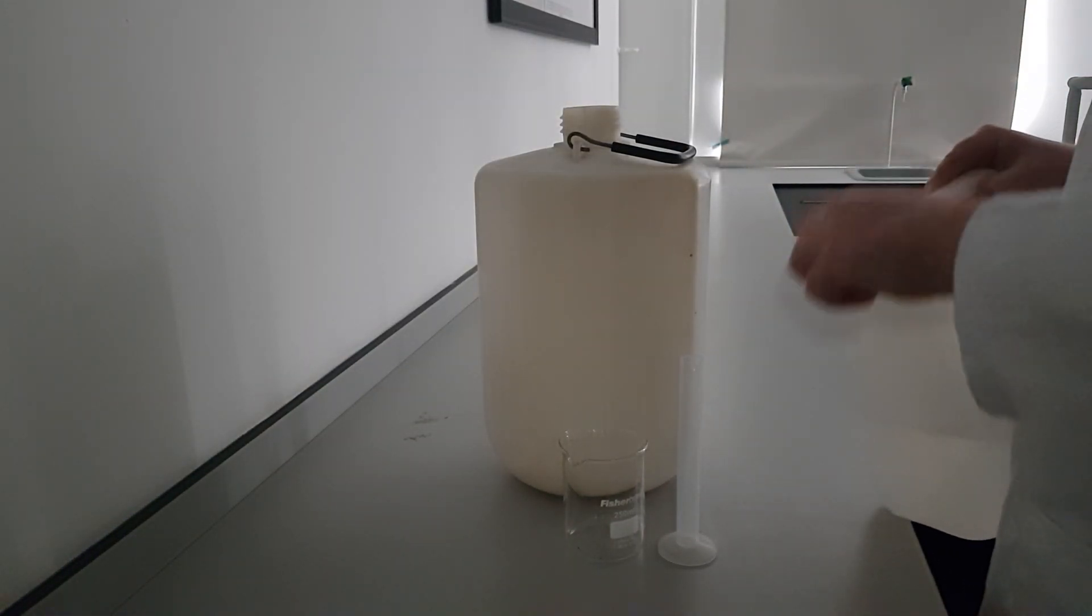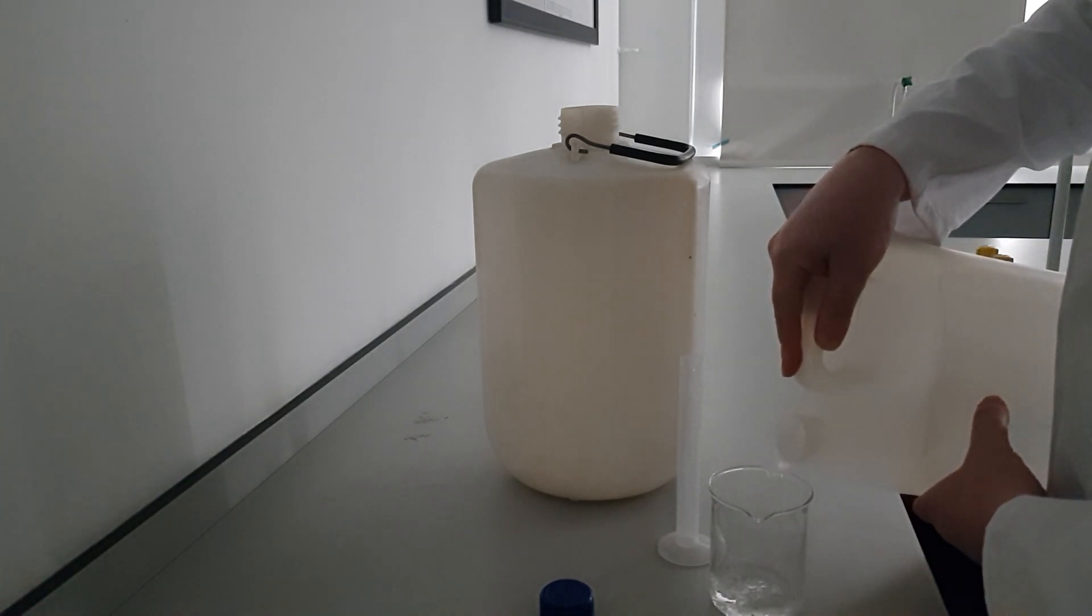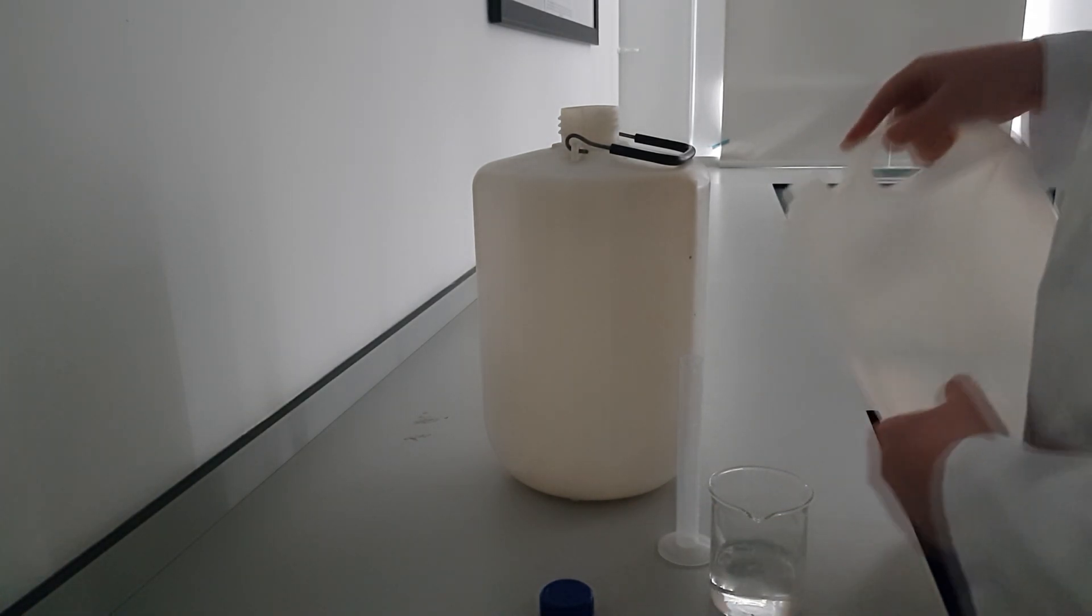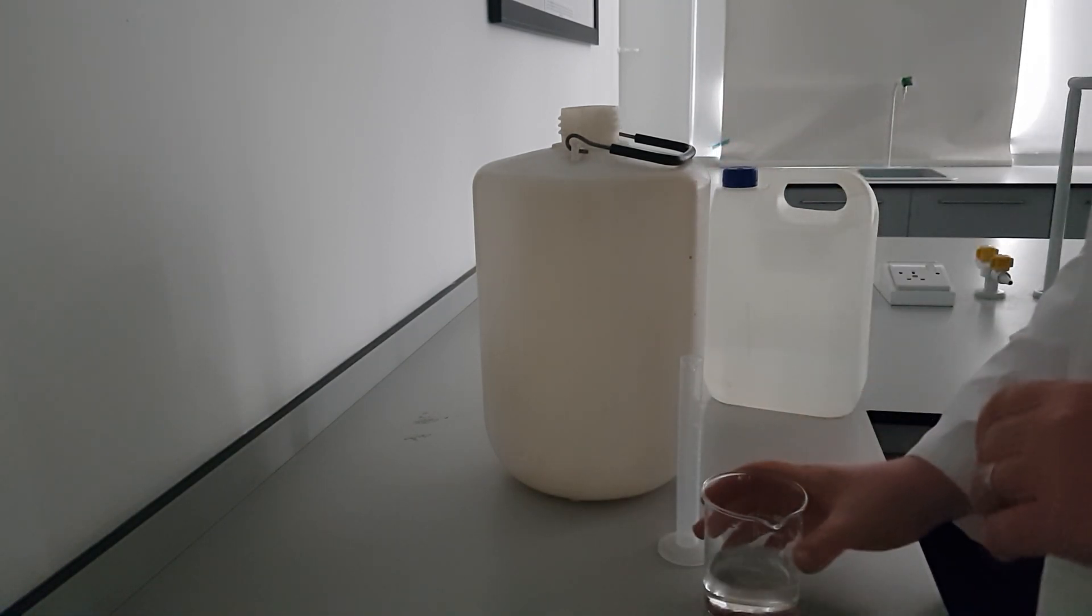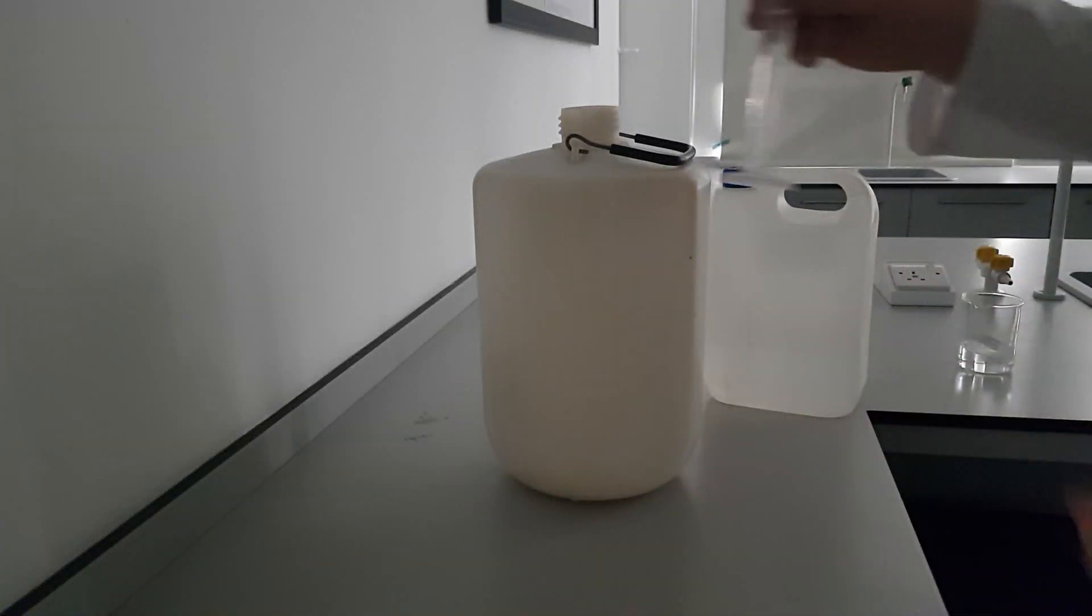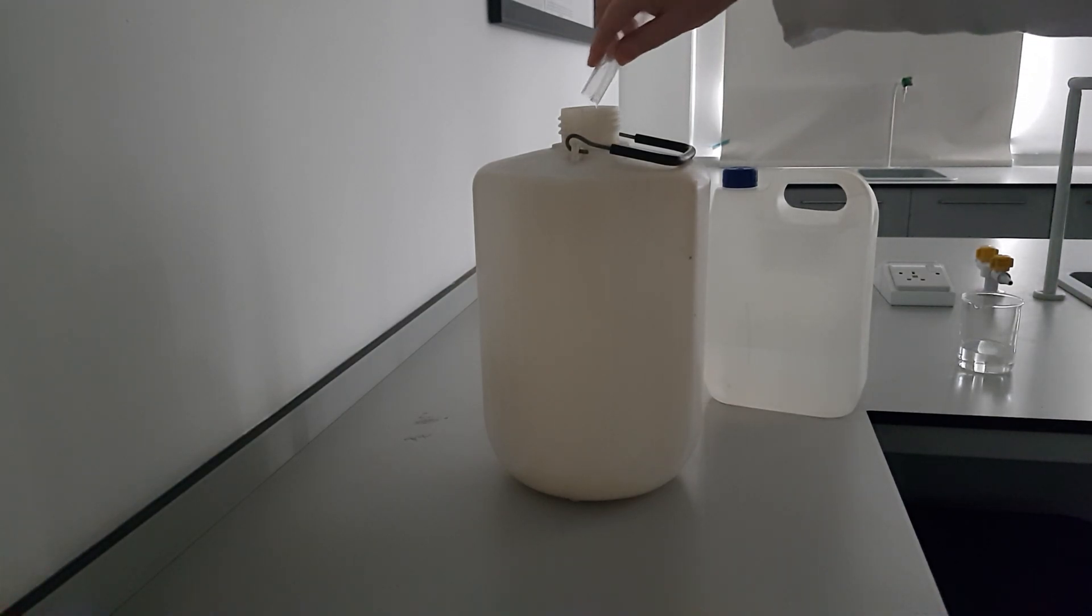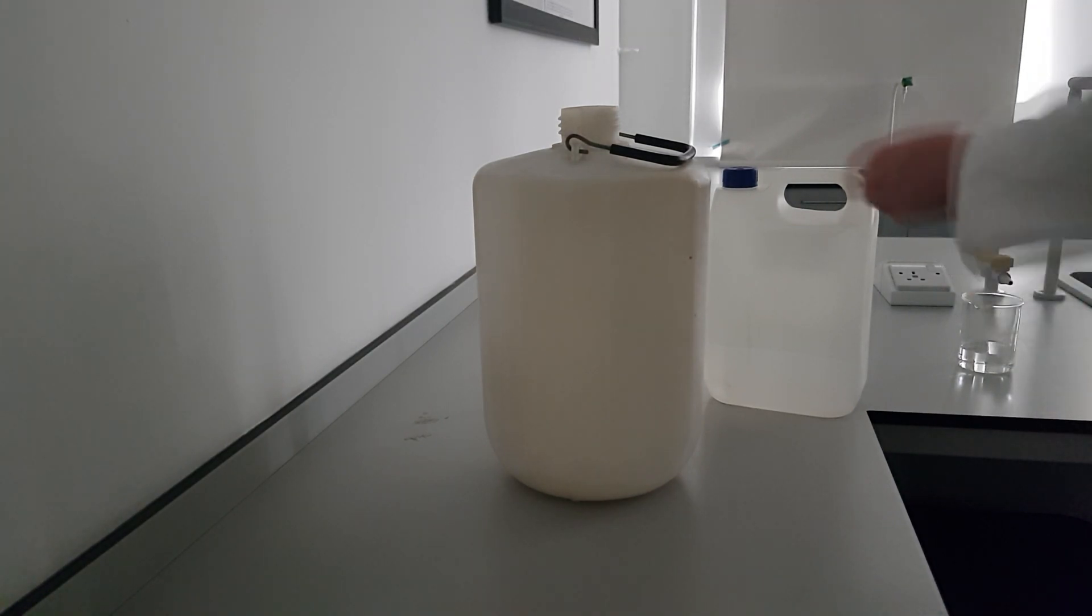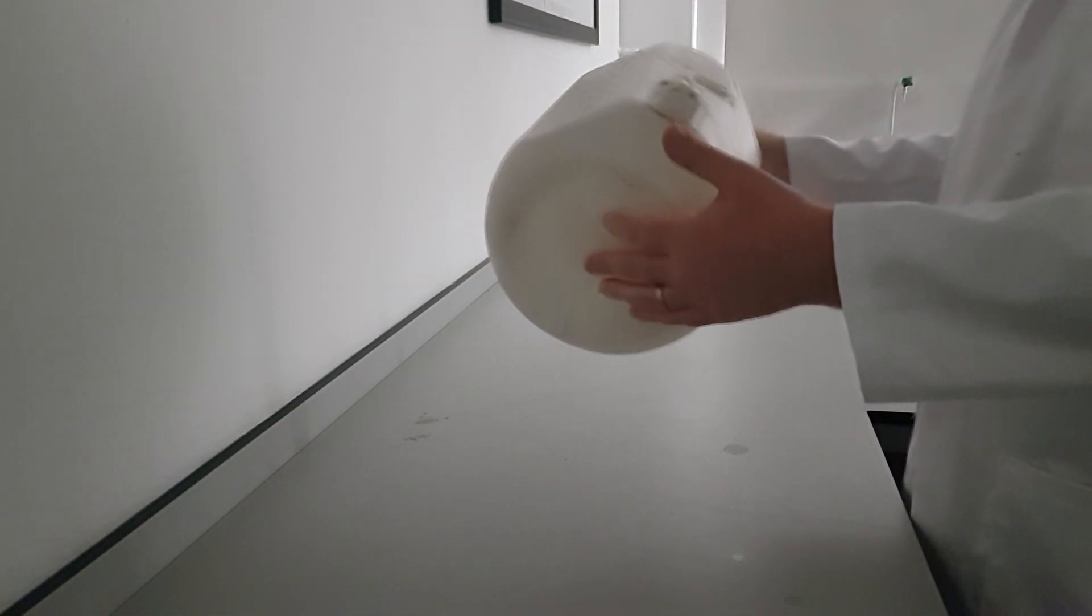Adding it to the large container. We roll the container around to ensure that the propanol touches every side of the container.